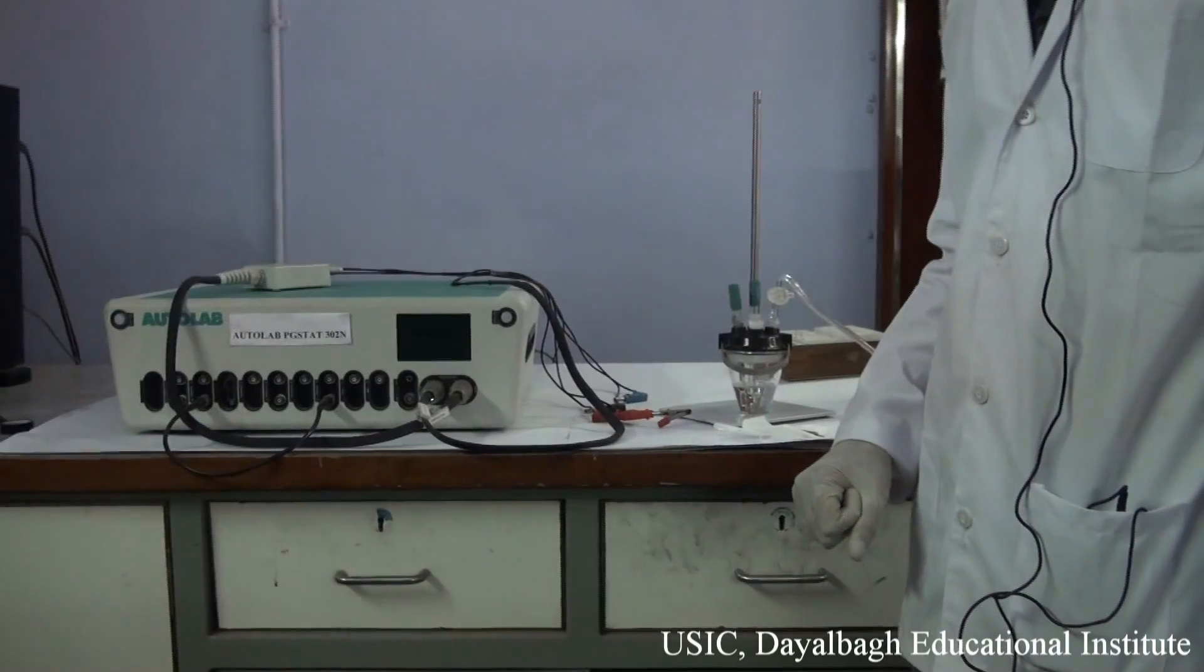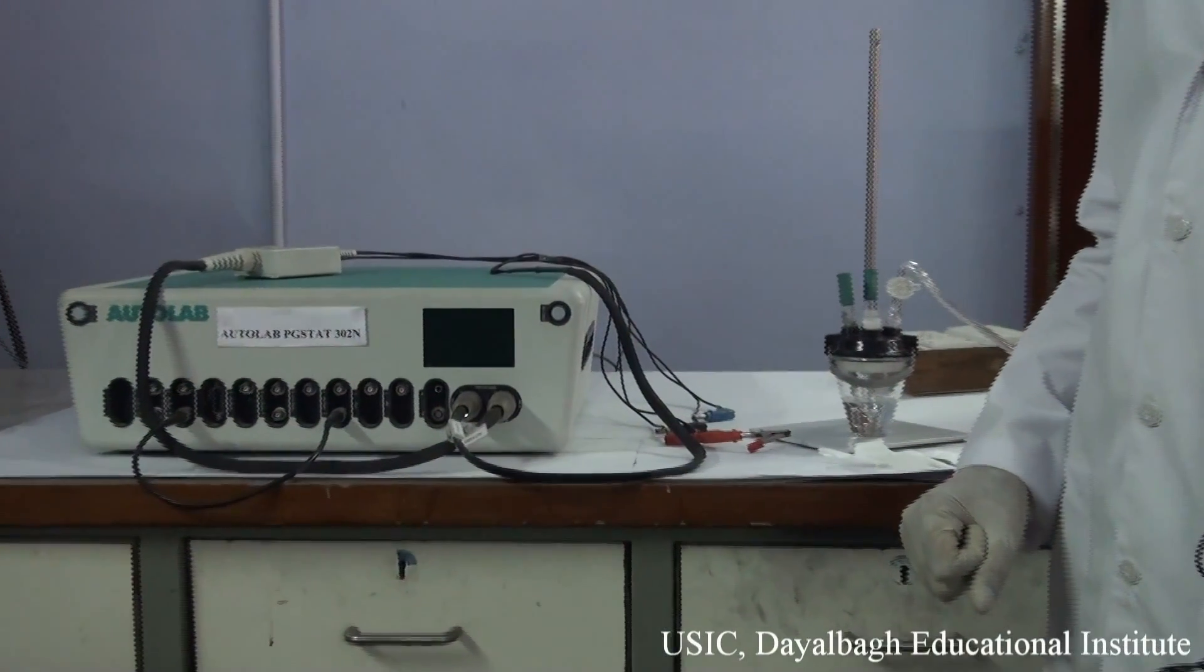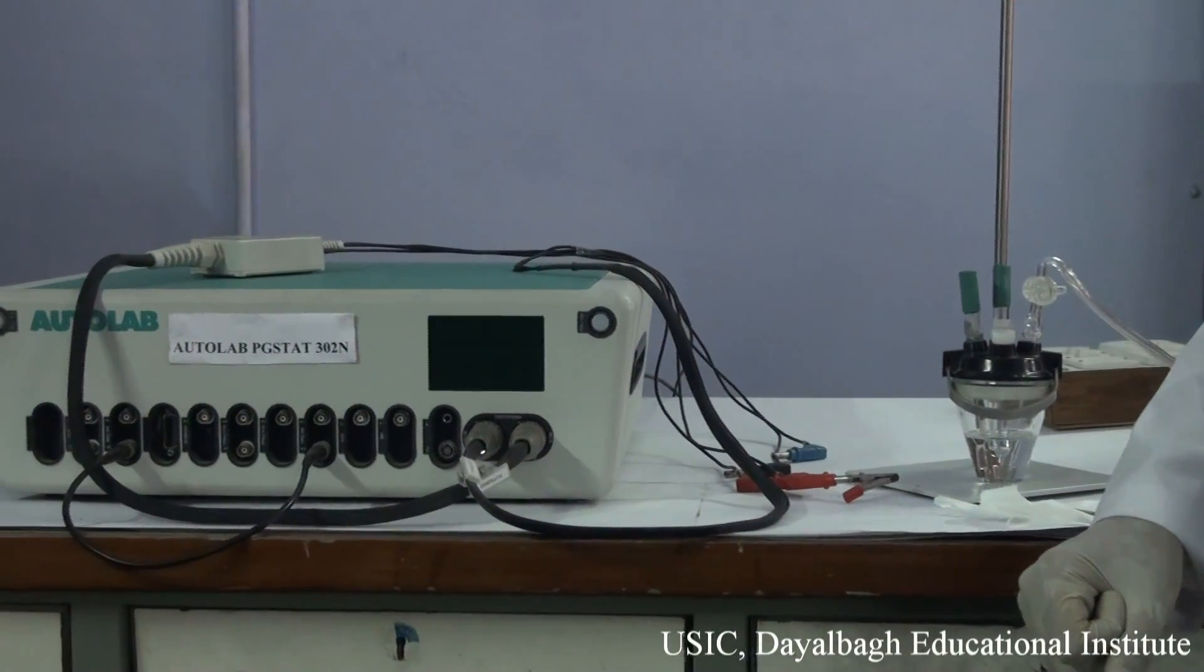The purpose of this experiment is to study the simultaneous determination of metals like lead, copper, and cadmium in the given water sample.